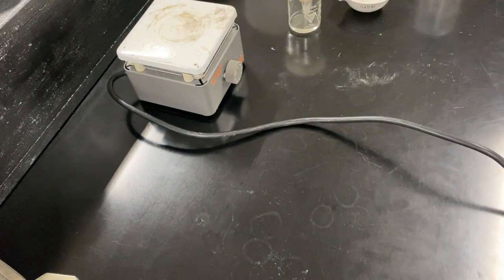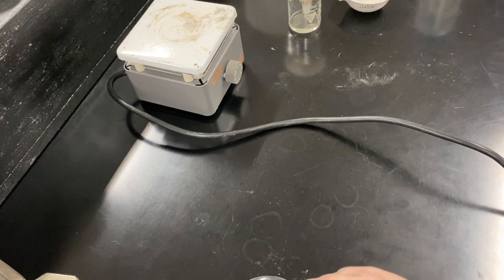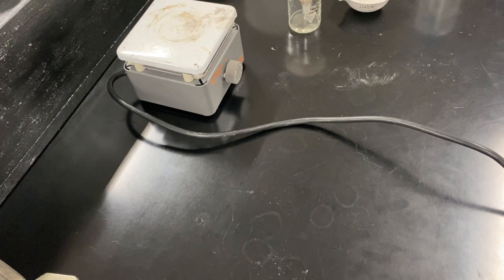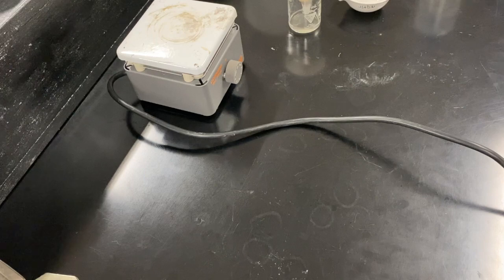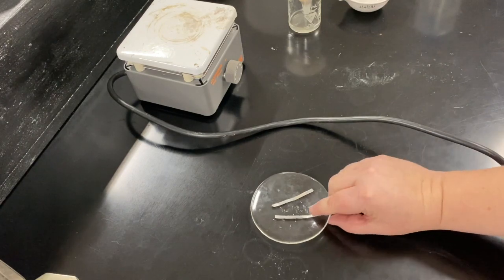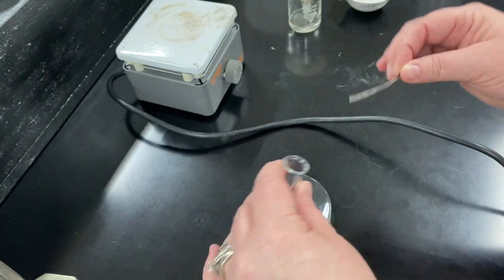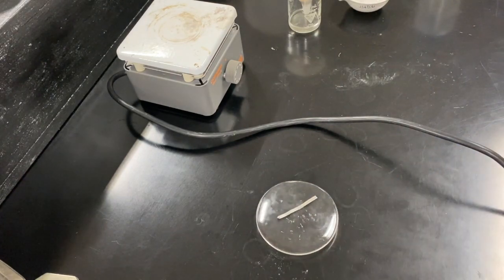While that is filtering, I'm going to set it to the side and do part of step seven. I have already cut two strips of magnesium. We are going to leave one unburnt, and then we're going to burn the other one to see if we still have the same substance after we combust these materials. These are shiny strips of metal. I'm going to put the unburnt one into a test tube for Part 8 and set that aside.